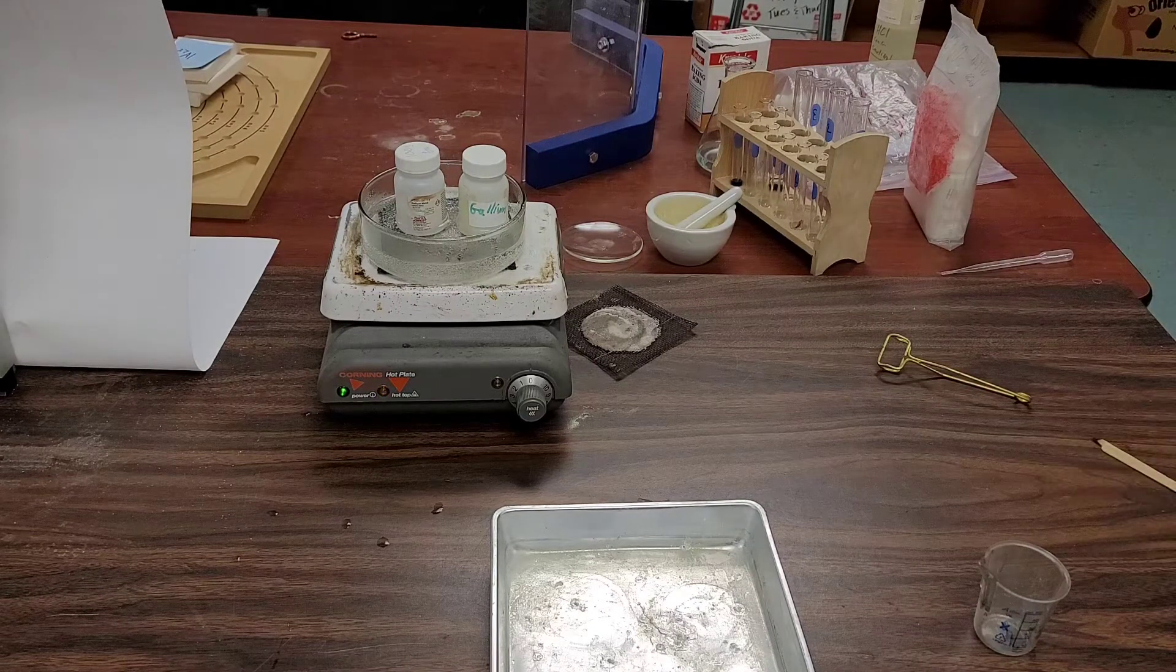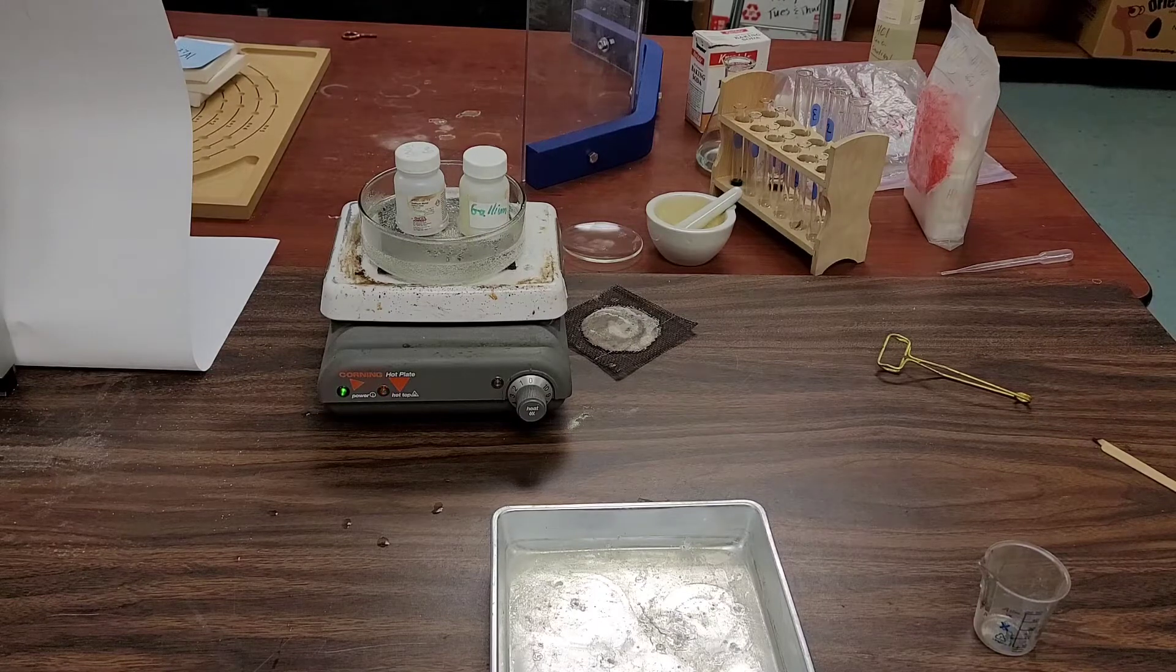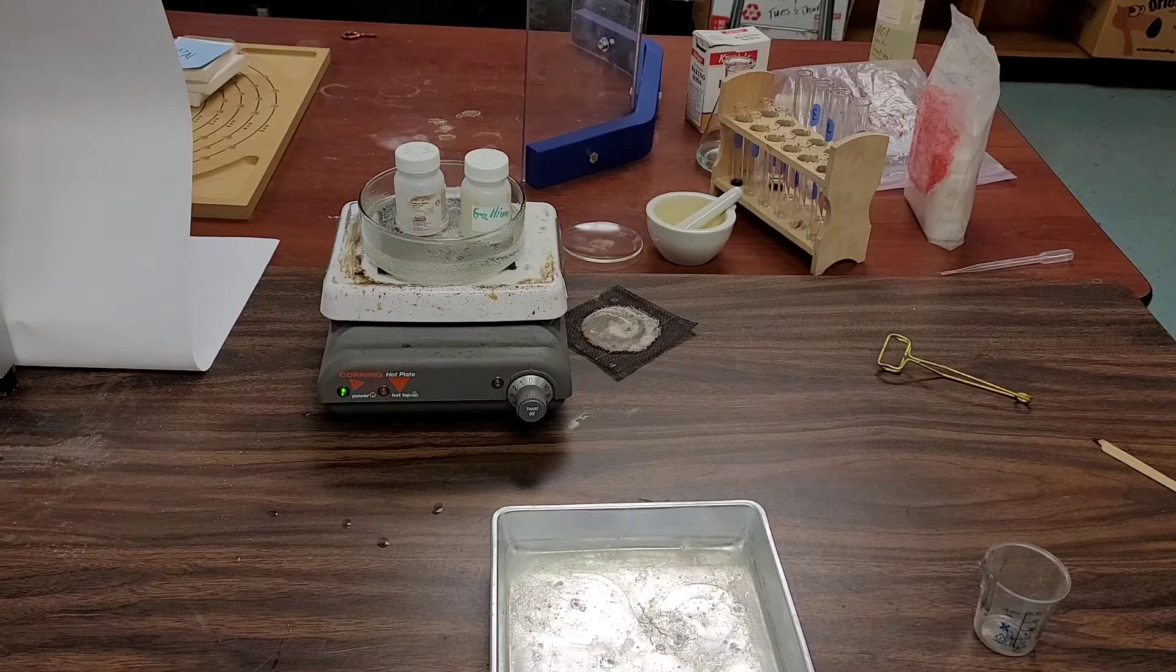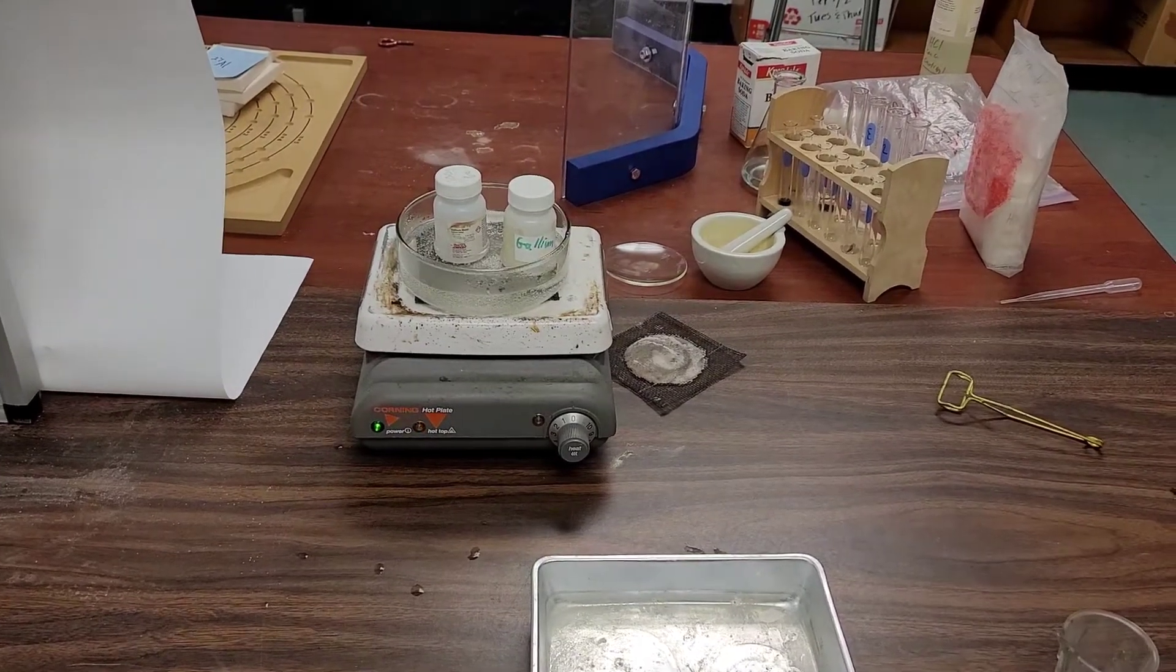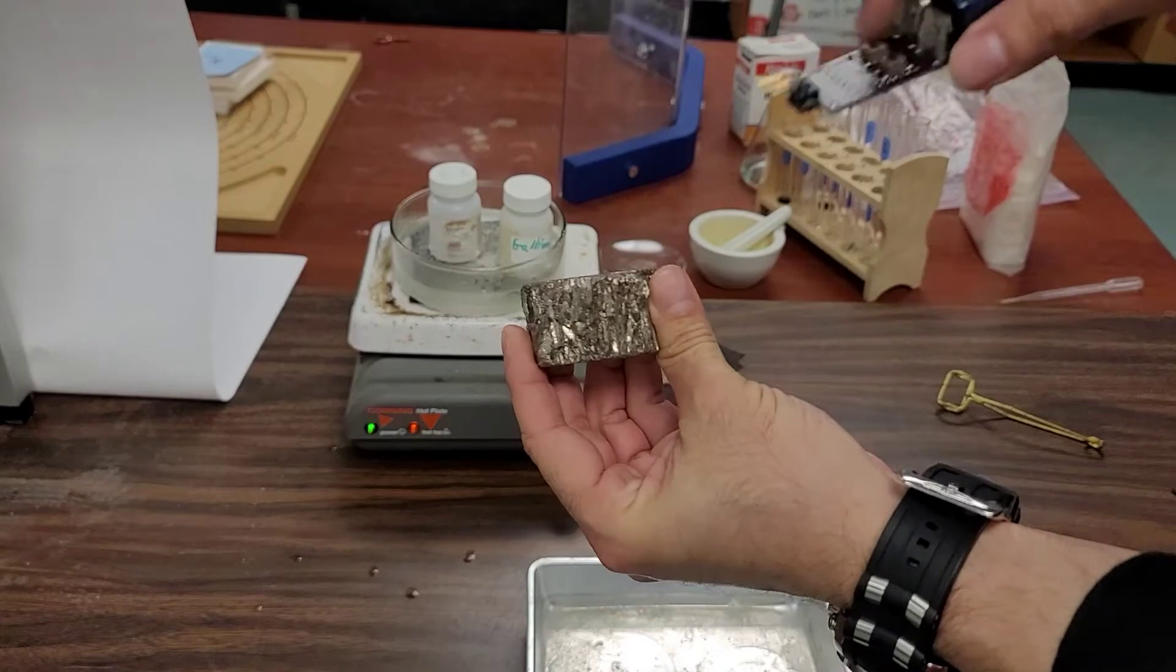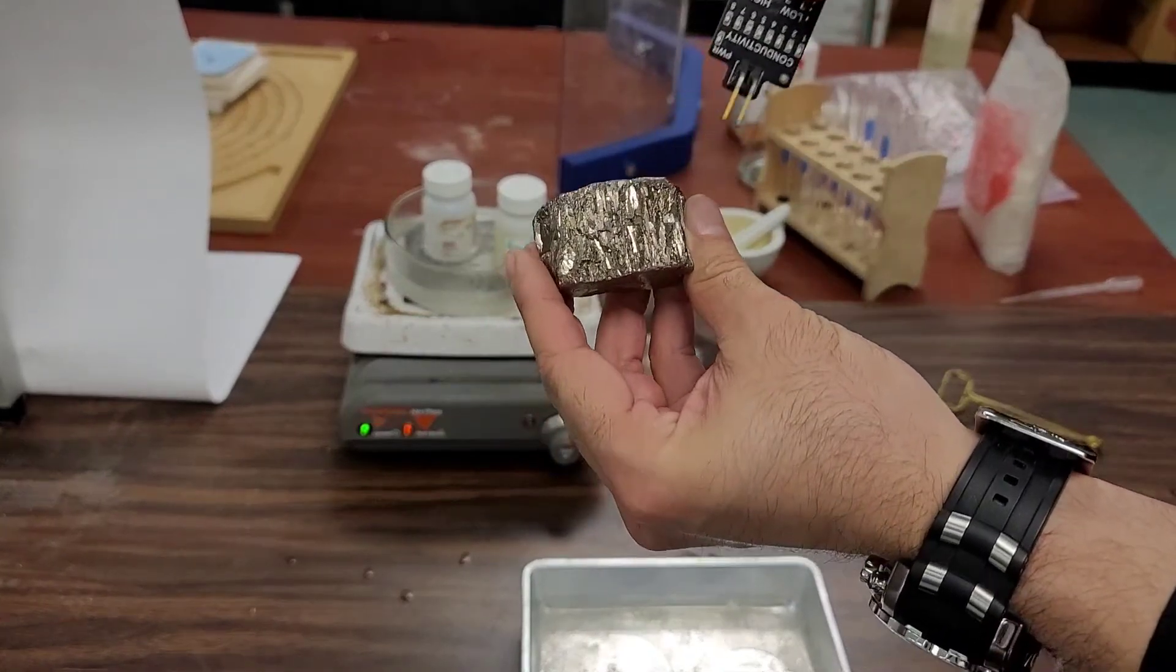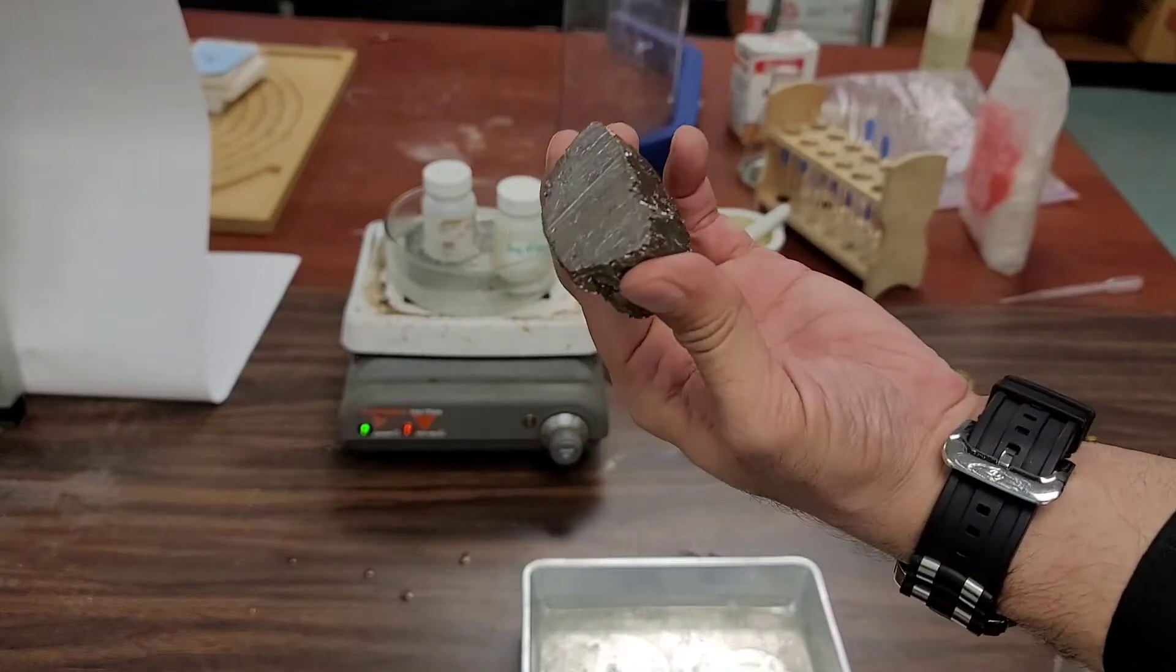And this is gallium, but before we actually check out gallium, I keep forgetting I dissed bismuth and forgot something in the last video, which is to check the electrical conductivity of bismuth. I'm so sorry I skipped that step. Okay, so here's a chunk of bismuth.